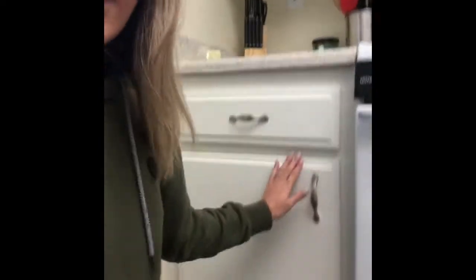Okay, so now I'm in the second place that I considered for incubation. I'm in my kitchen. I considered this cupboard right here for incubation. It is next to the stove and it is next to a window. Therefore, it would not be reasonable to make that my incubation spot.